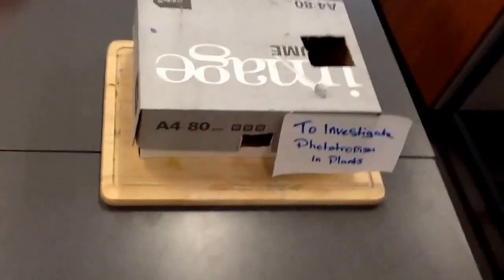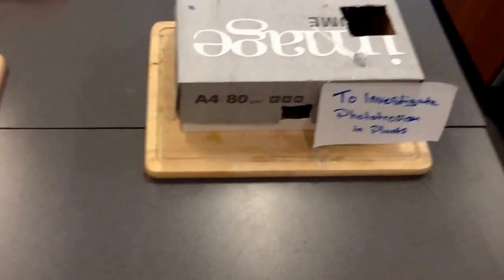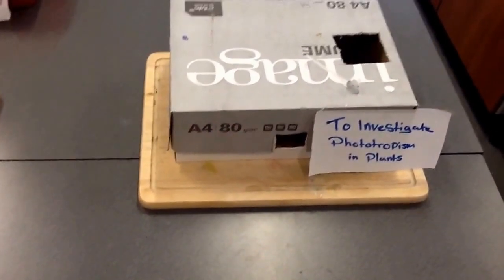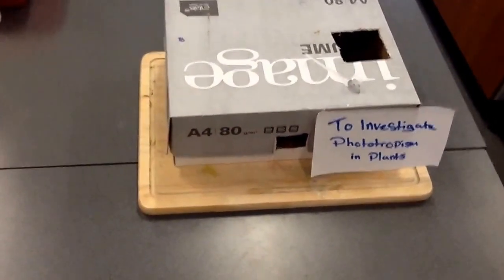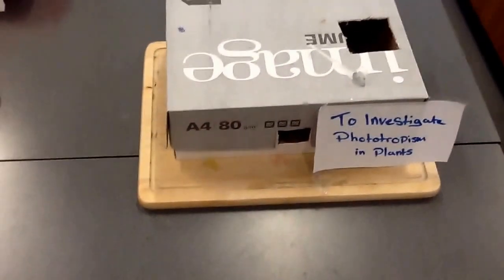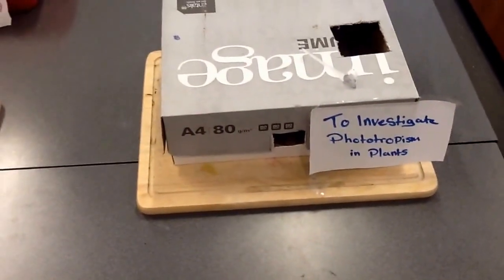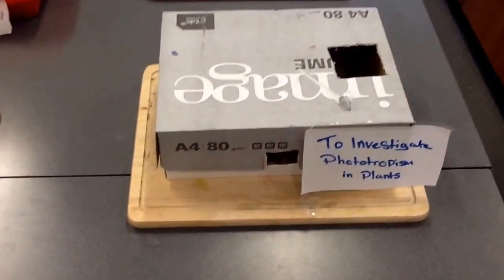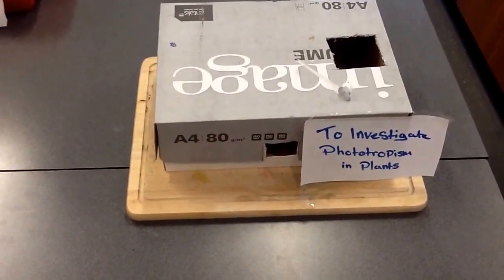The next experiment is to investigate phototropism in plants. We got a box, planted some cress seeds in trays inside, and added water to all the trays.